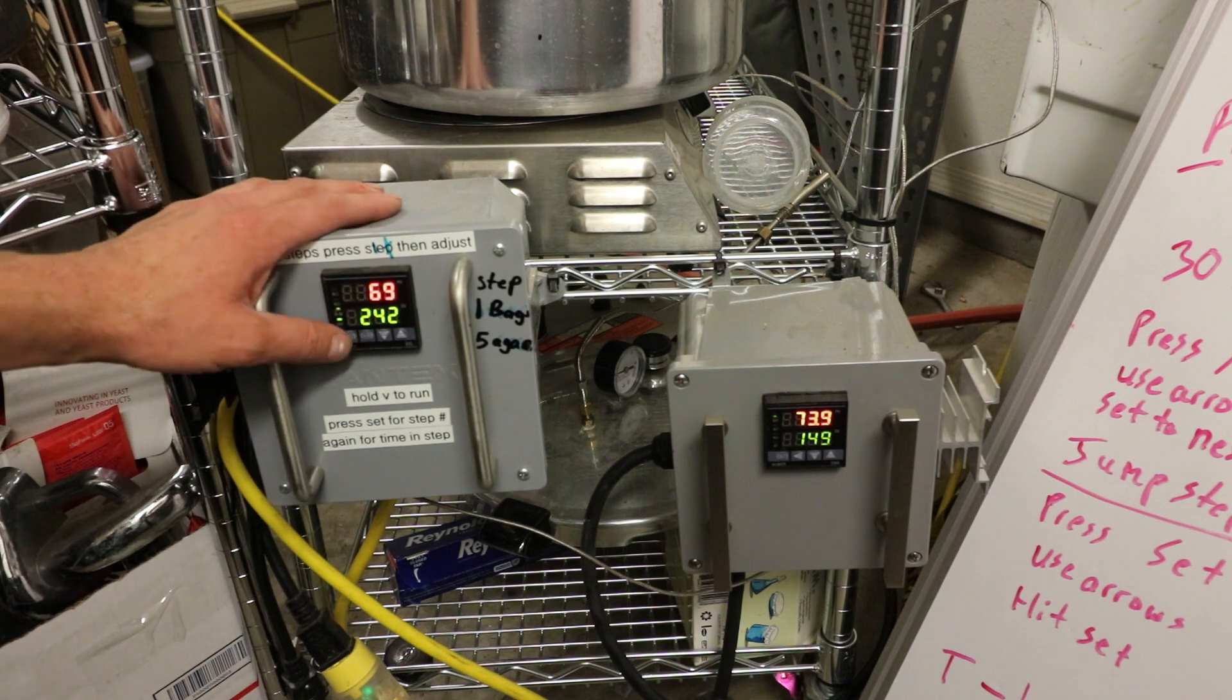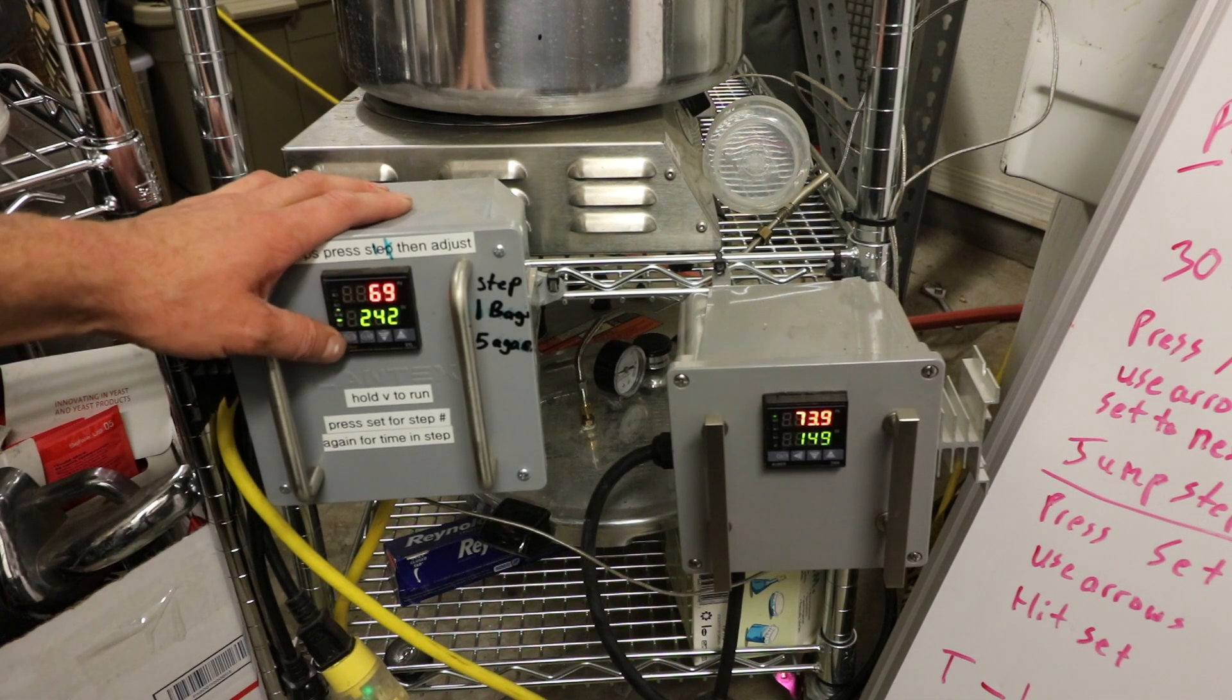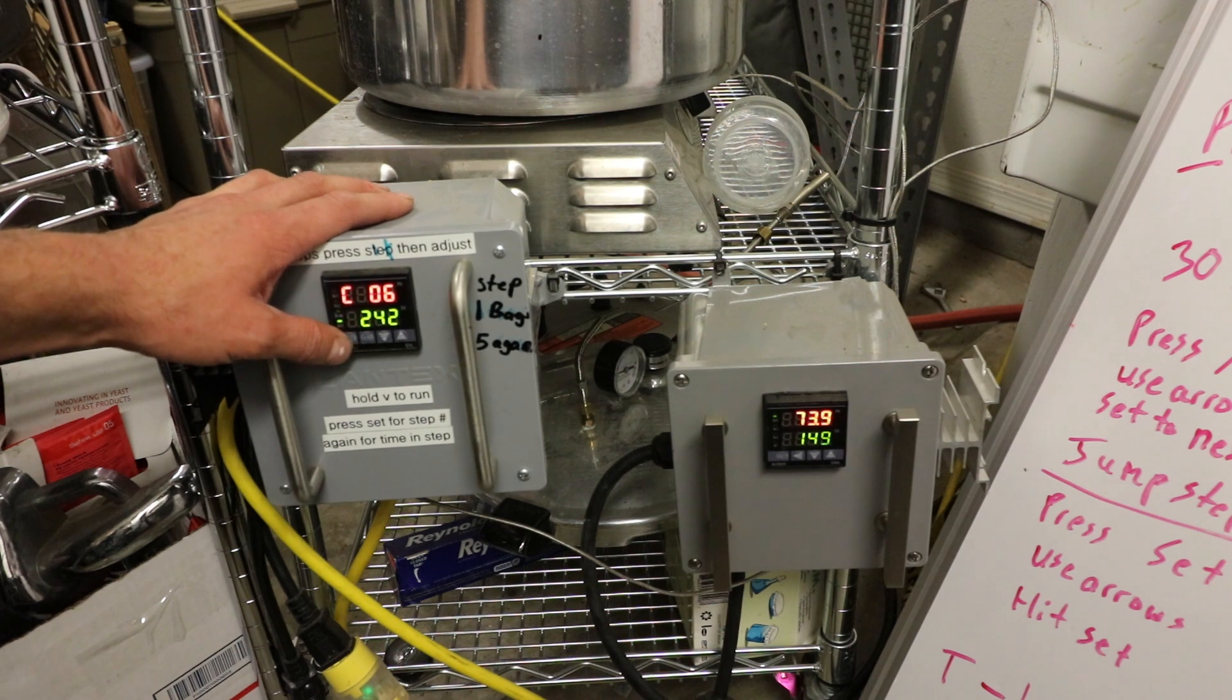So I just got to wait a couple seconds here. Alright, so quickly hit AM. And yeah, so that's how you do all the steps.